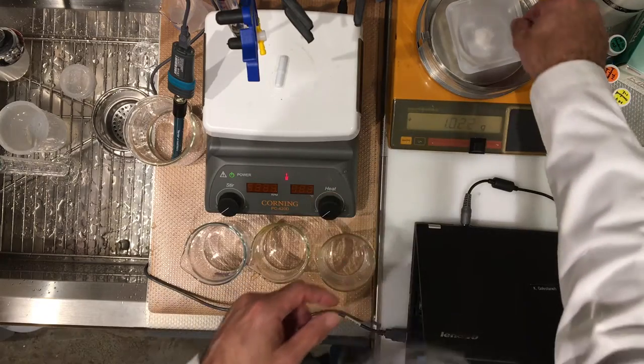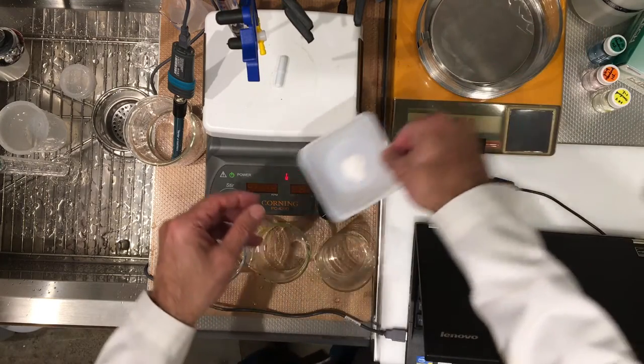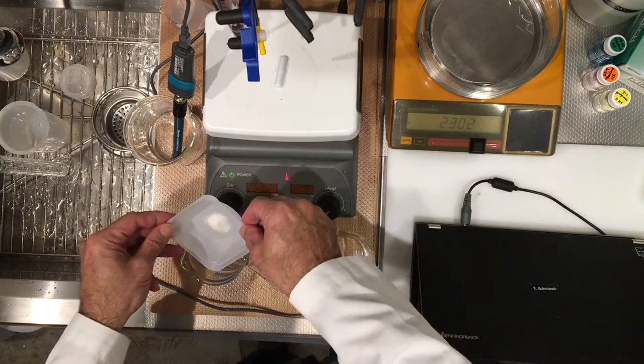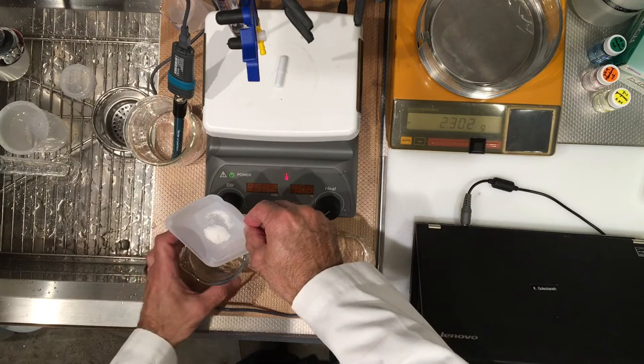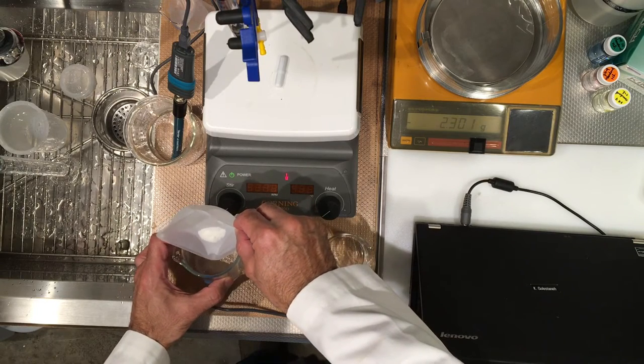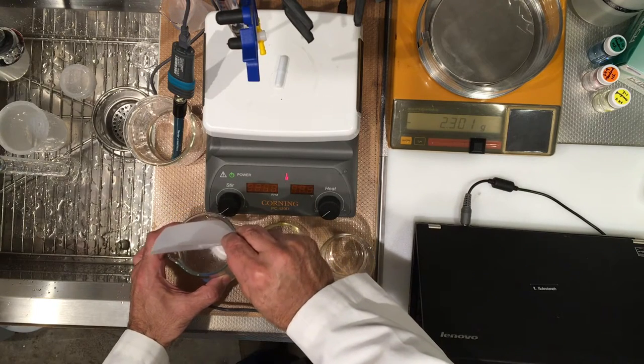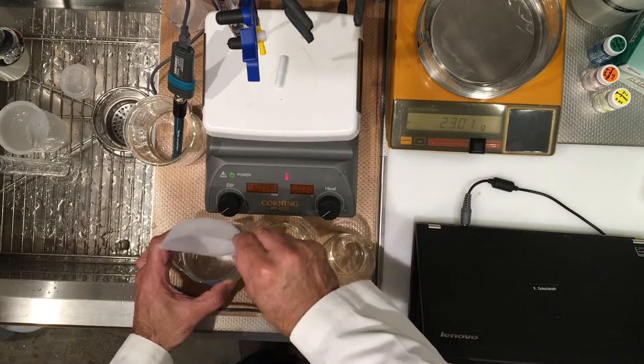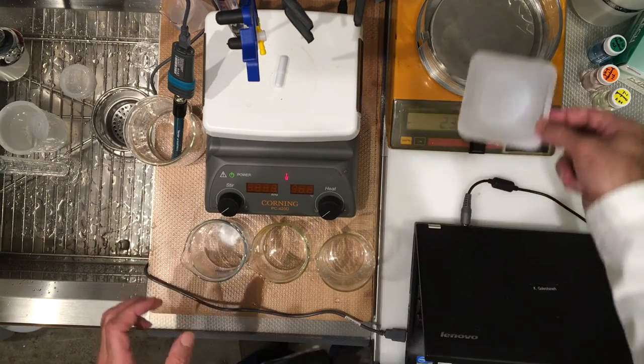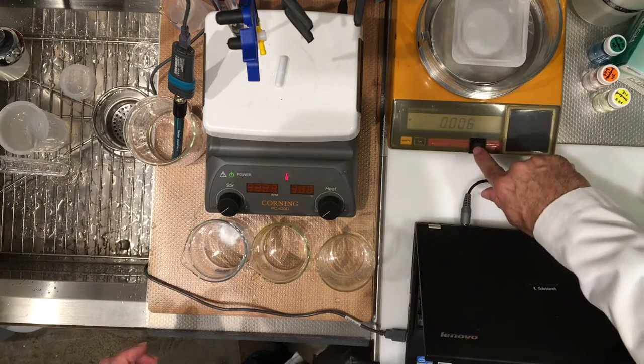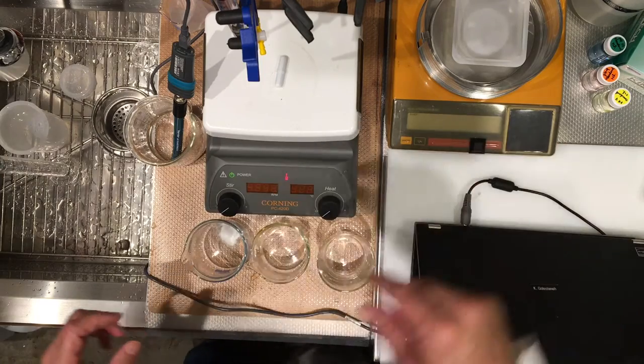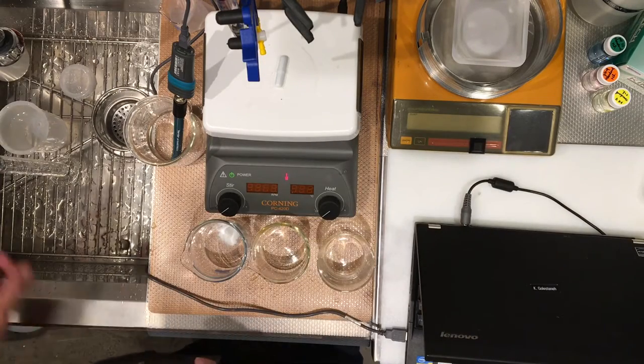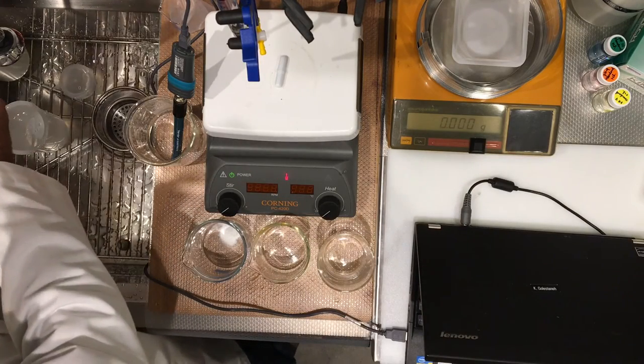Okay, I'm going to transfer this into the beaker, and I'm just going to dry transfer this. All right, now we're ready for the second mass, but because I want this to dissolve, I'm going to add my 25 milliliters of water, and give it some time to dissolve.